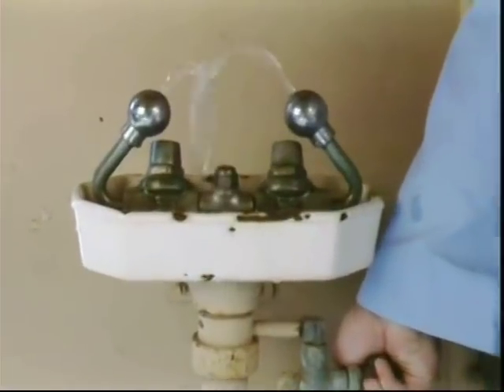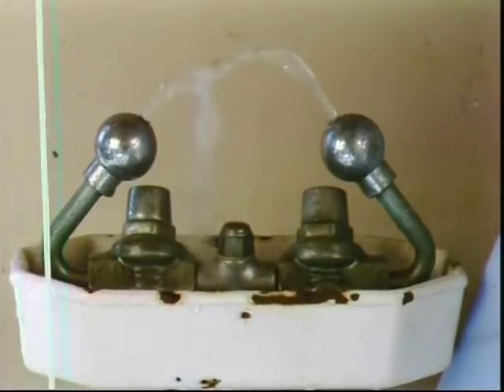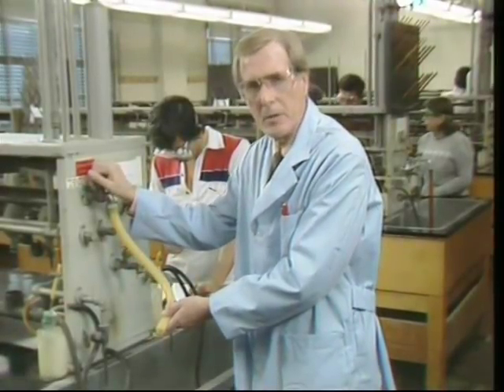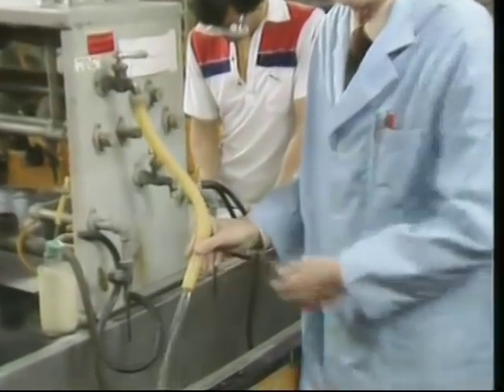The third piece of safety equipment in your lab is an eye wash. Find out where it is. If any chemicals get into your eyes, go to the eye wash immediately. If your lab does not have one like this one, there will be a length of hose attached to a faucet on a sink or some other device for washing eyes. If ever any chemicals get into your eyes, wash them immediately and continue washing them for 15 minutes.